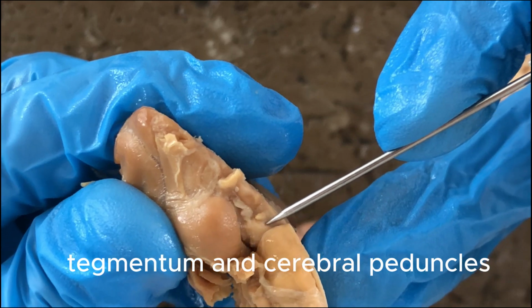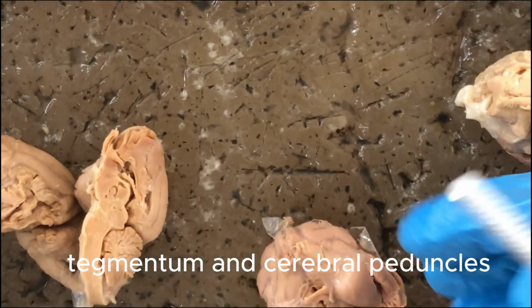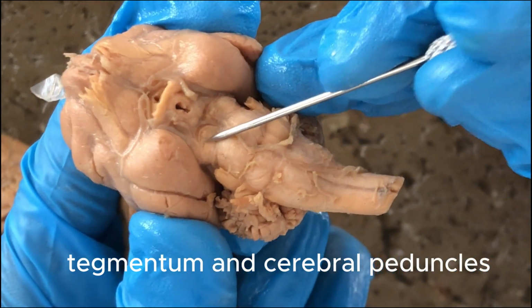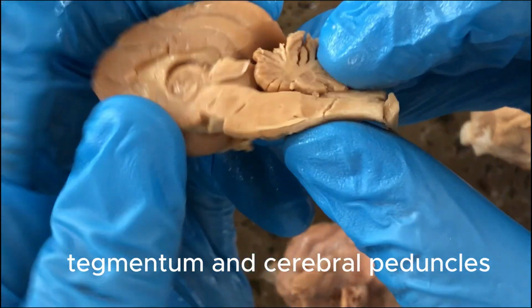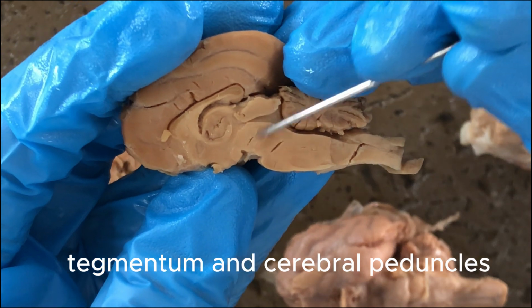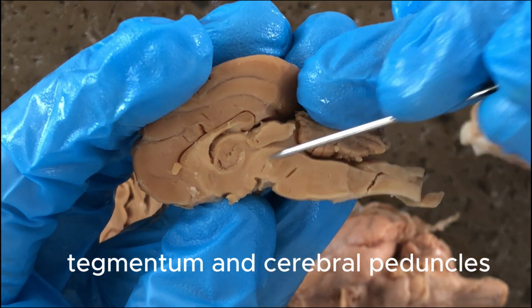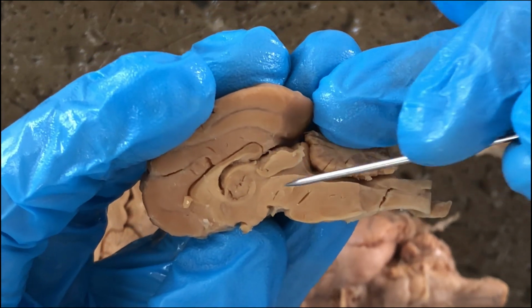The cerebral peduncle is also part of the midbrain. Let me show you again. Cerebral peduncles. Cerebral peduncle. The floor of the midbrain is generally called the tegmentum. This area here, tegmentum. And this would be the corpora quadrigemina.